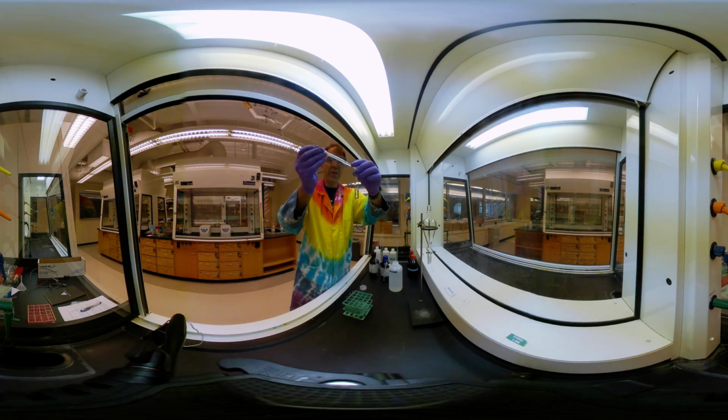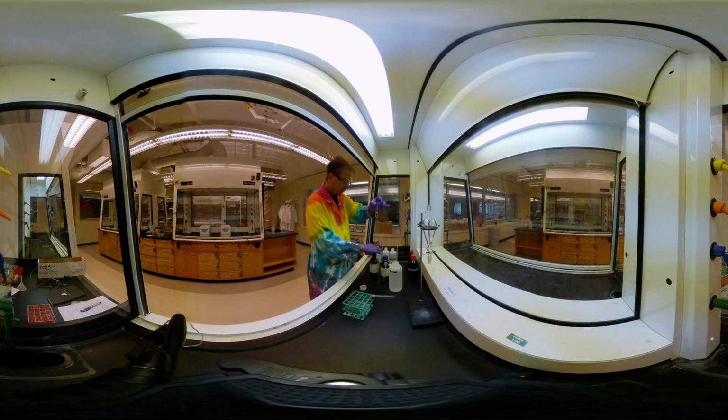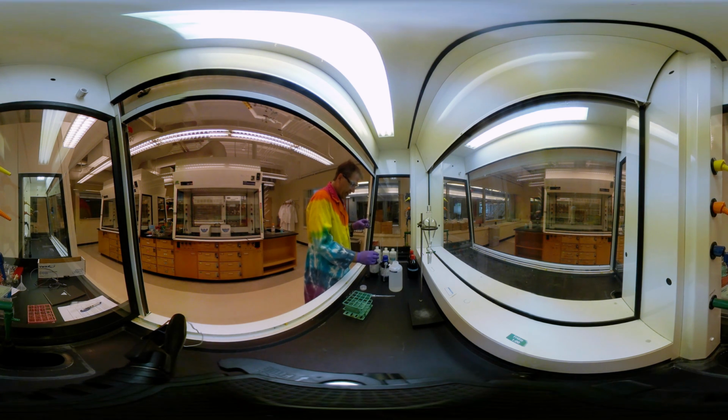So what we're going to do is I'm just going to take a couple of drops of water and we're just going to see where that water goes. Okay, now hopefully you can see as I do this on the camera that my drops of water are actually sinking through to the bottom. Okay, that tells me that water is on my bottom layer. We can test that by also putting in a little bit of hexane. And so we'll do that, and it stays at the top layer. Okay? So in this case, it looks like our aqueous layer is the bottom layer.